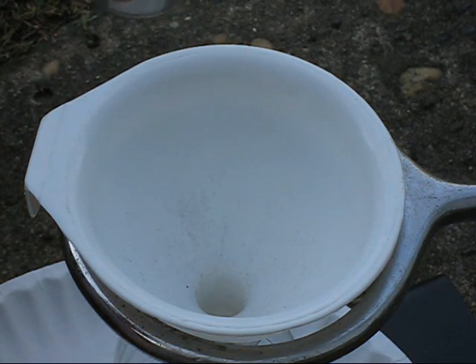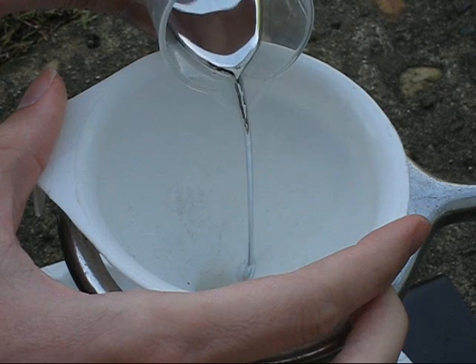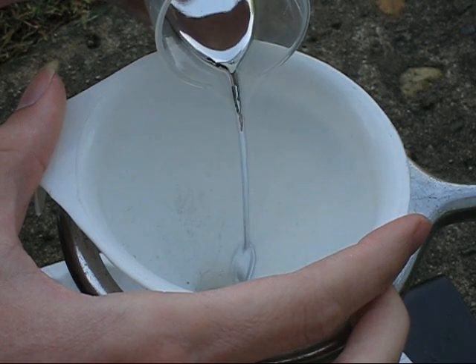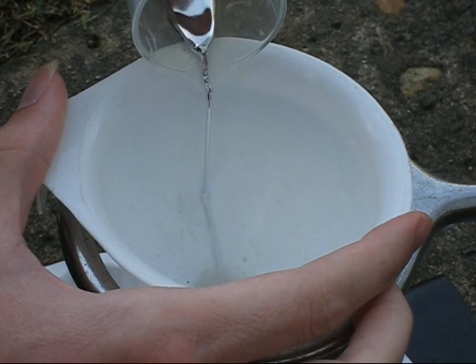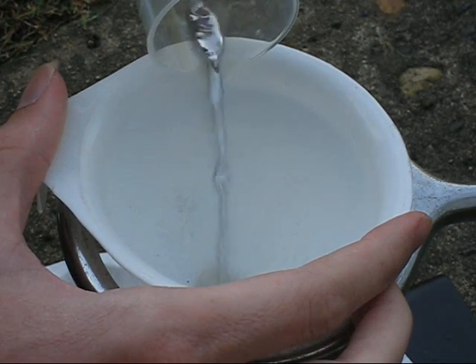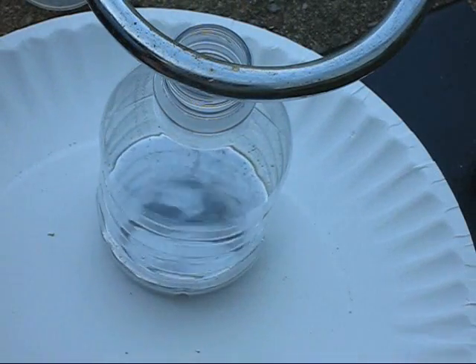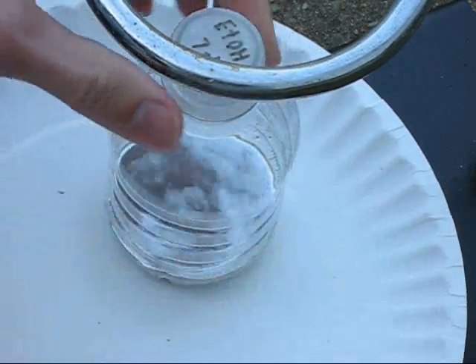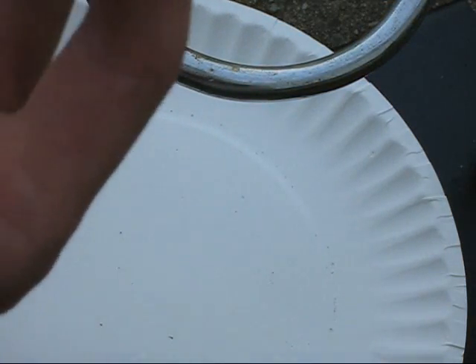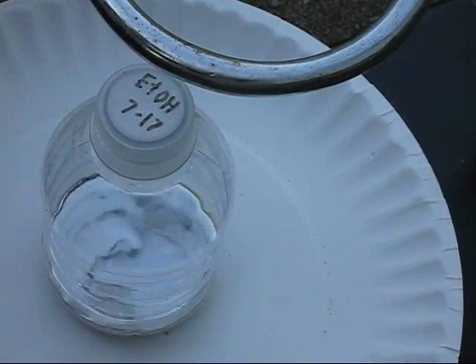Unfortunately I'm very low on time, so I have to put this into my container without the purity I'd like, but it did help a lot. The silver sure is quick, gotta give it that. There it is — it's shinier now. Probably a couple more filtration steps could take care of the rest. Don't want it tight, gonna have to check it later for vapor leaks. Alright, there's the camera. Gotta clean up my mess here — slight little dribbles, very tiny.